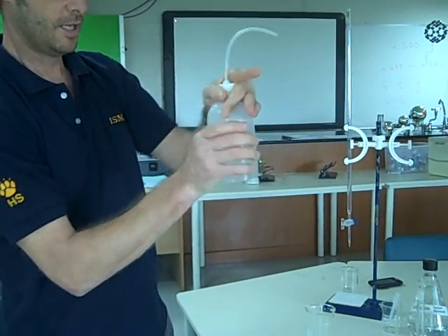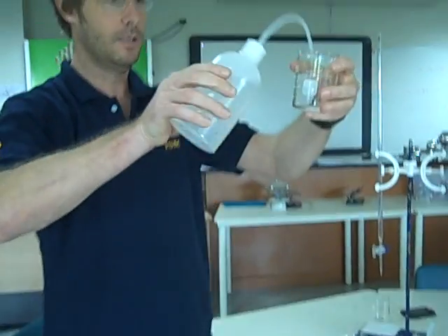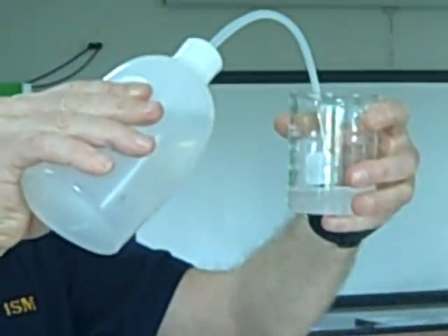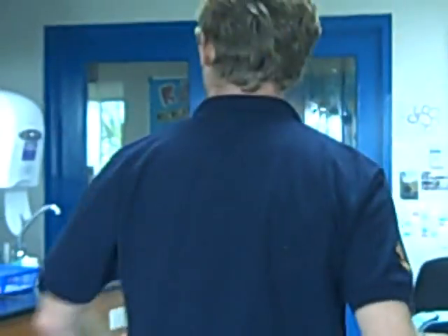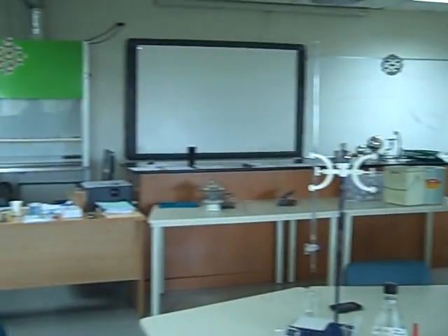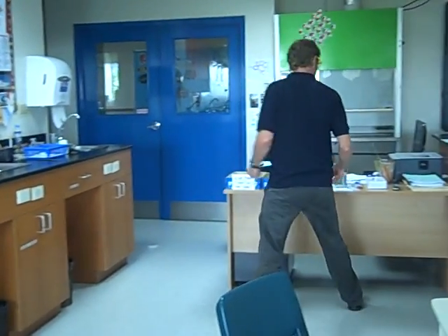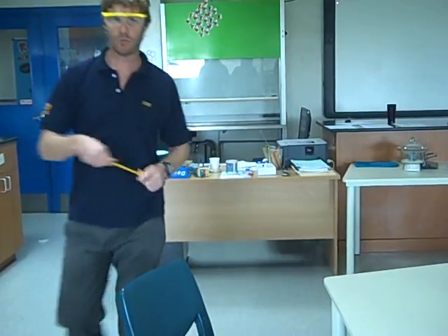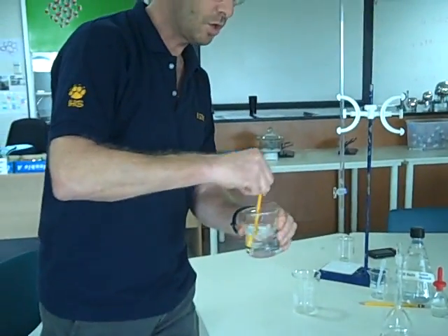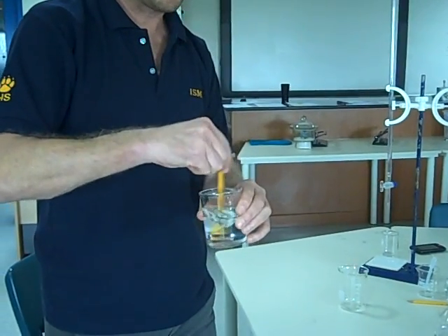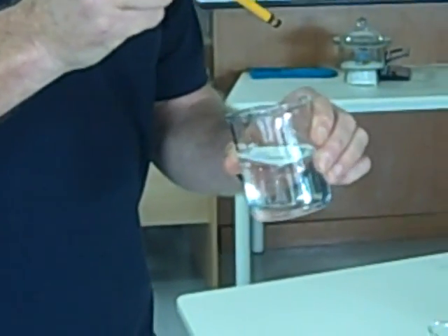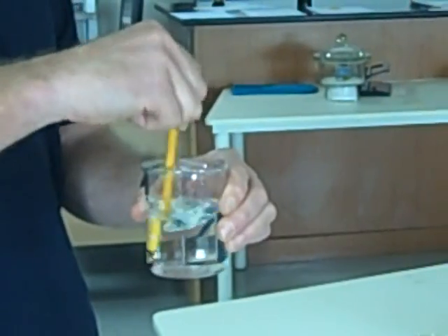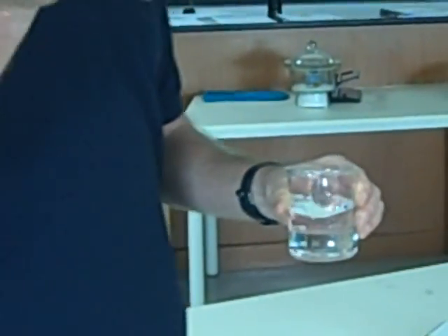That doesn't work. I can't take the lid off. So I'm going to put in my beaker less than 250. I've got about 150 mils of distilled water in there, and I'm looking for a glass stirring rod, and I can't find any. With your glass stirring rod, you dissolve the solid into the distilled water. That's completely dissolved. The solid is very soluble. That's my glass stirring rod.